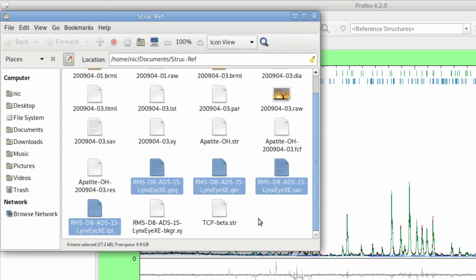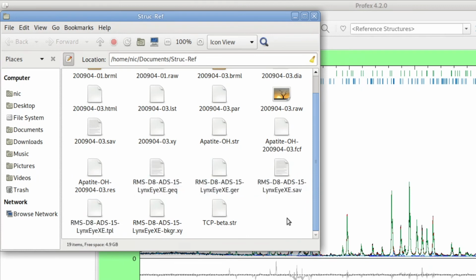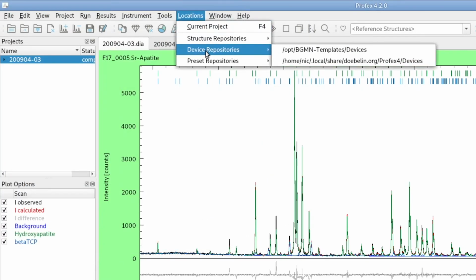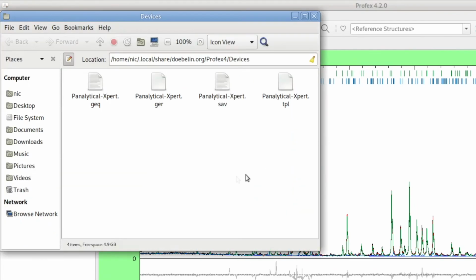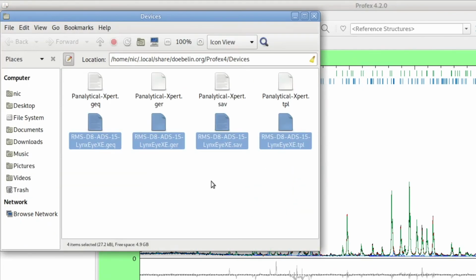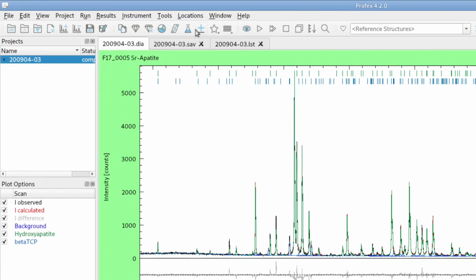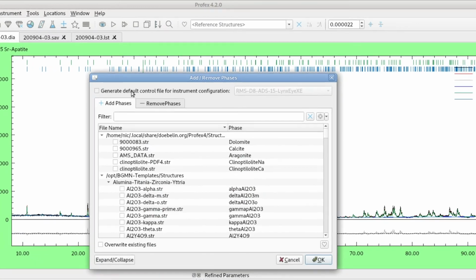inside the project directory. So to make them available to all projects from the selection dialog, we have to copy these files and go to locations, device repositories, select our personal local device repository and paste them here. Now they will show up in the add remove dialog here.